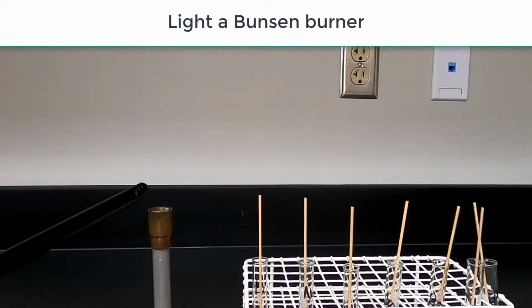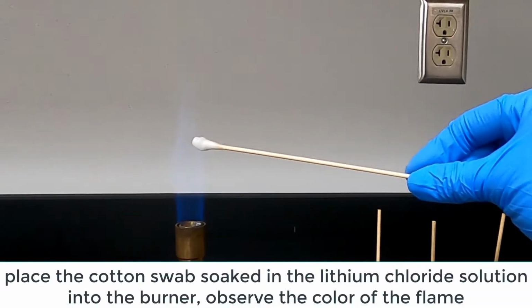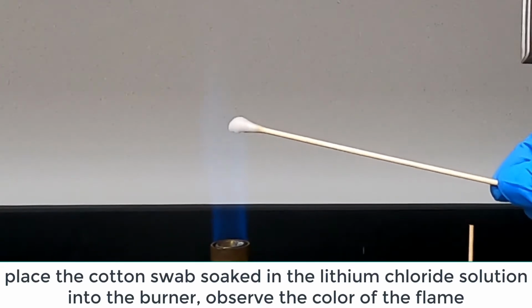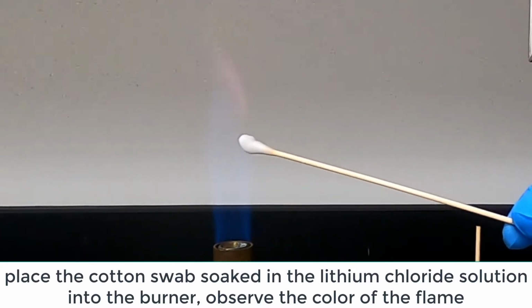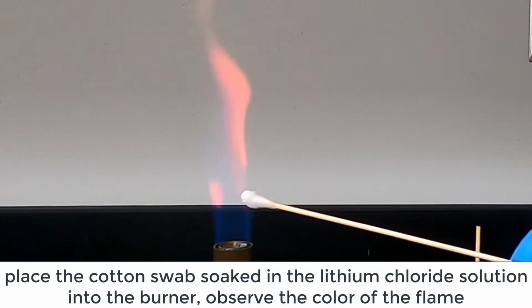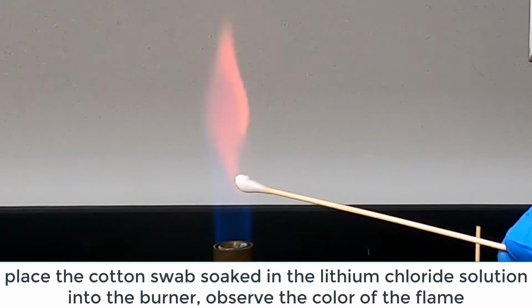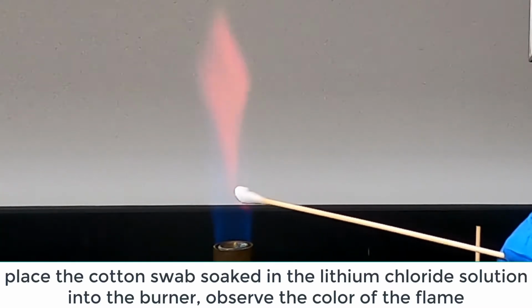Light a Bunsen burner. Carefully place the cotton swab soaked in the lithium chloride solution into the burner. Observe the color of the flame. Record your observations on the datasheet.